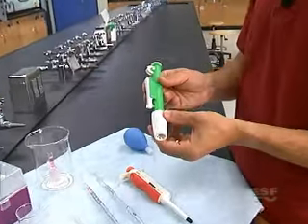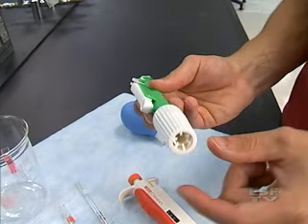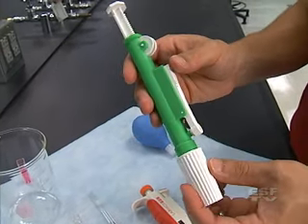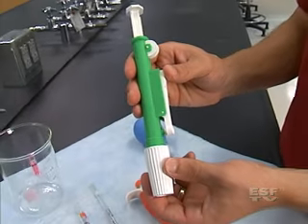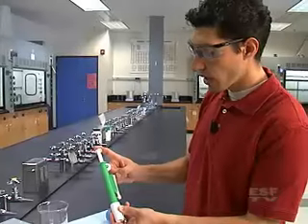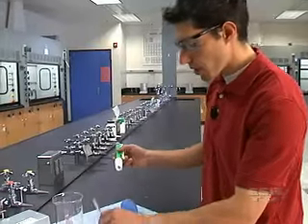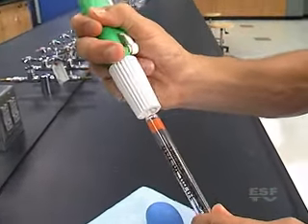The pipette pump has a few different parts on it. It has the hole where you put the pipette, a wheel which you use to withdraw the solution, and then a lever on the side for draining — this uses gravity to drain the solution. You never ever want to drain the solution using the top pump. Just use gravity. The first thing we do is put the pump onto the pipette and push it on there.